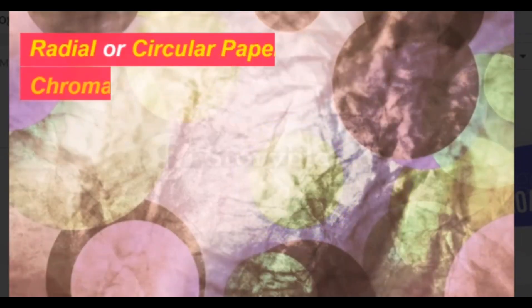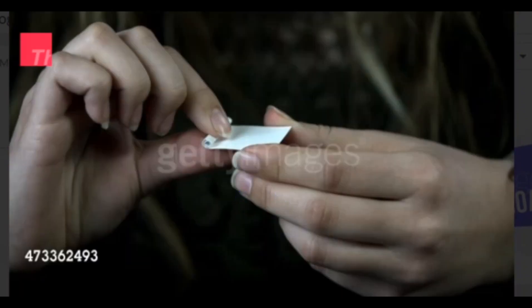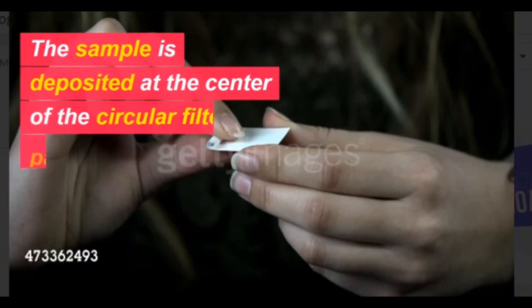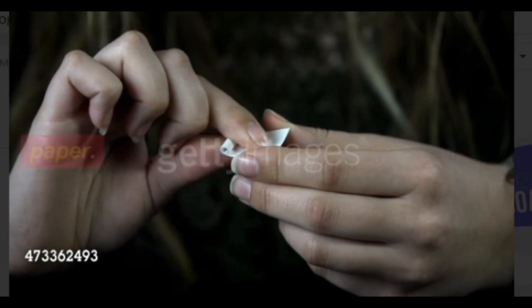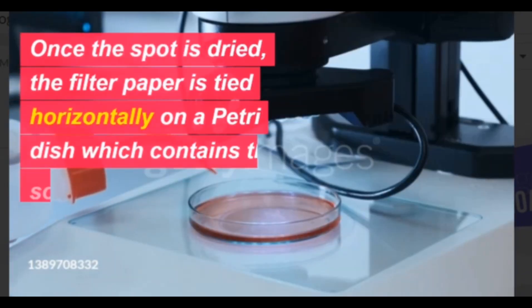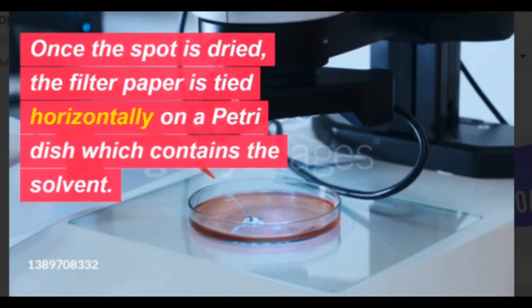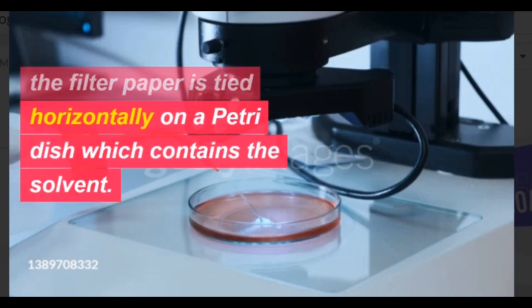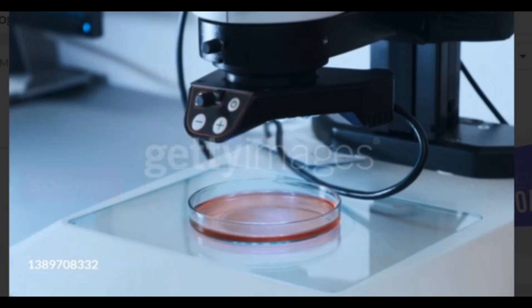4. Radial or circular paper chromatography. The sample is deposited at the center of the circular filter paper. Once the spot is dried, the filter paper is tied horizontally on a petri dish which contains the solvent.